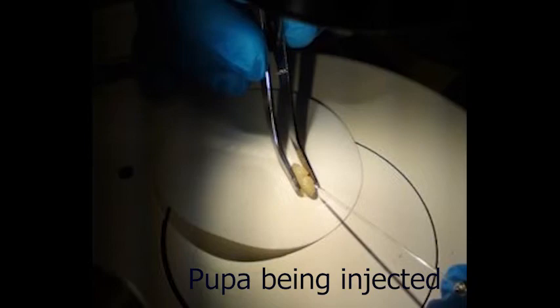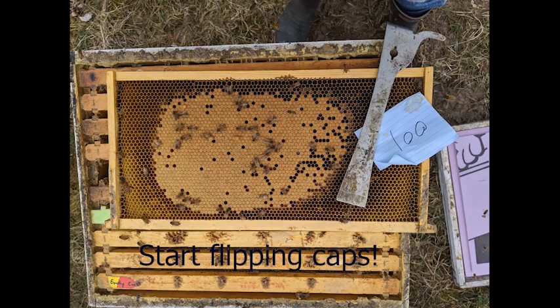And we do this traditionally by opening the caps with a pair of forceps, carefully removing a pupa. As you might expect, this is really, really difficult and takes a really long time to get very many. But we figured out a way in collaboration with a few other people to do this in a much faster and easier way.